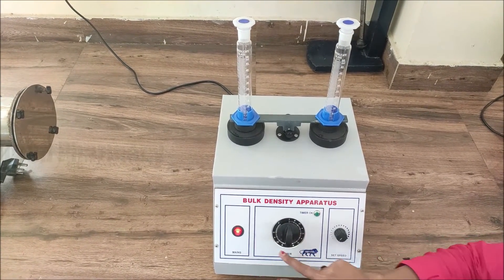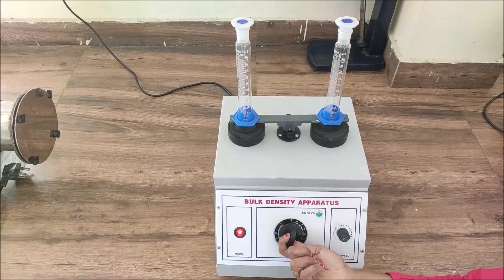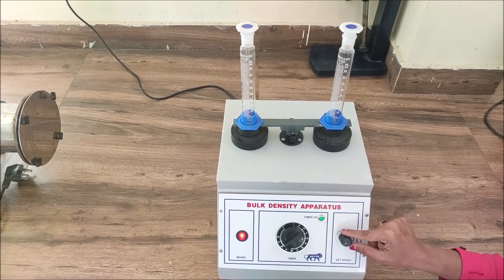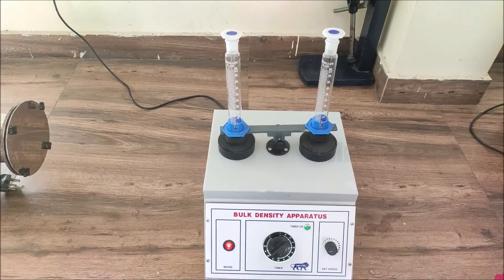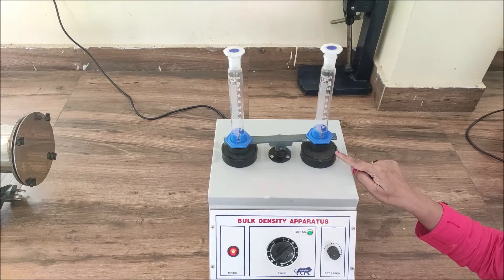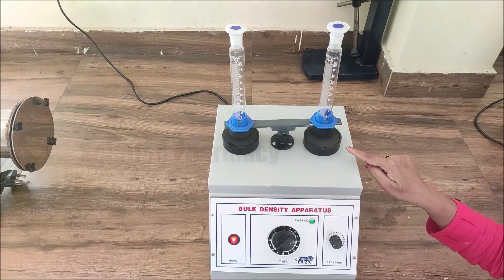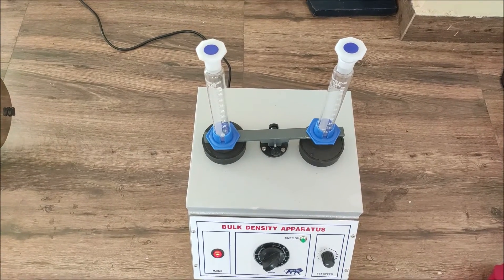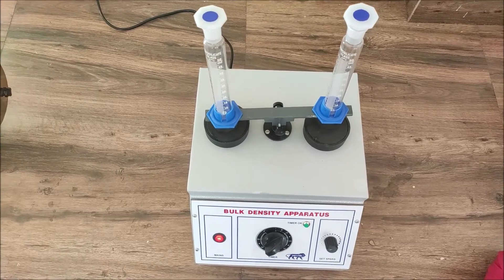First, switch on the power button, then rotate and set the timer knob according to the number of tappings required. According to the time, we then set the speed. Next, rotate the speed control knob anti-clockwise to set the tapping speed in such a way that the total number of tappings is completed within the time set on the timer — so we set time and speed together according to the total number of tappings required.